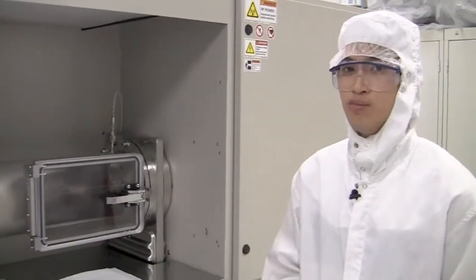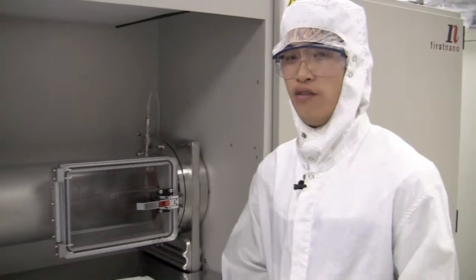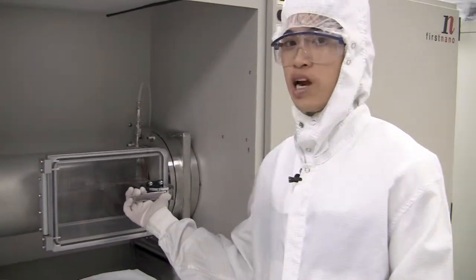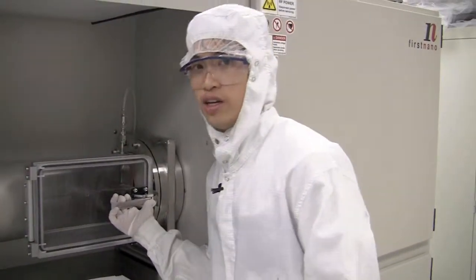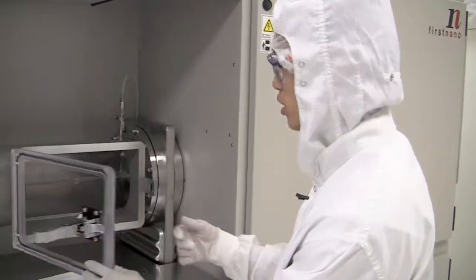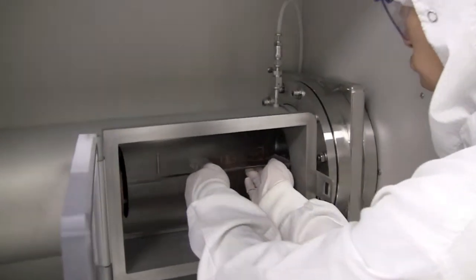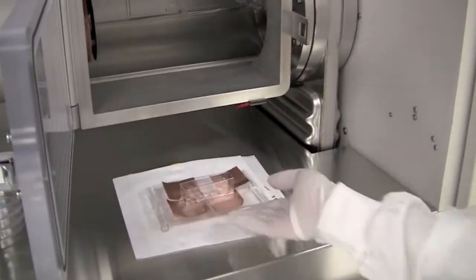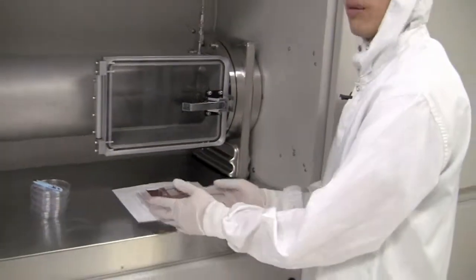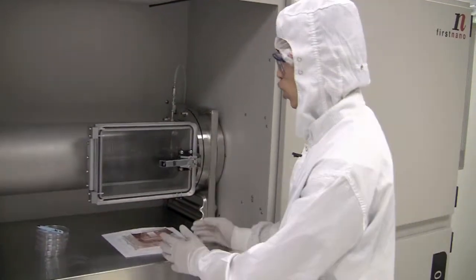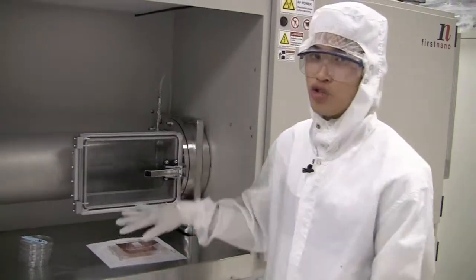Usually if you do this right after growth, the quartz boat is going to stay really hot, so be careful when you remove it. We're going to open up the loading chamber again and gently remove the quartz boat from the loading arm, placing it down. We can close the chamber and now we can remove our samples. When you remove your samples, you can put the quartz boat back onto the loading arm, close the door, and your process is now complete.